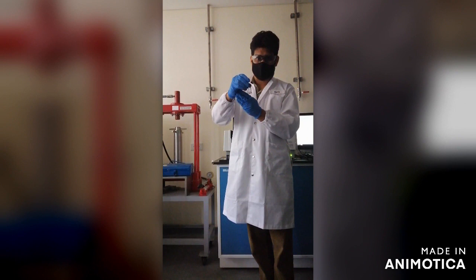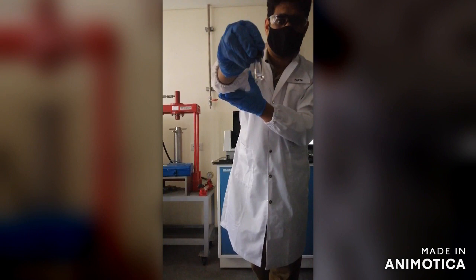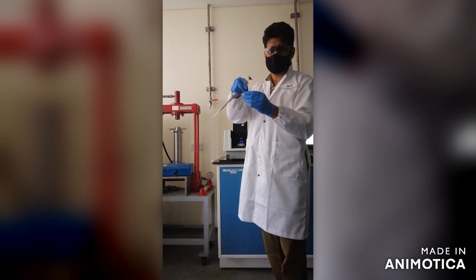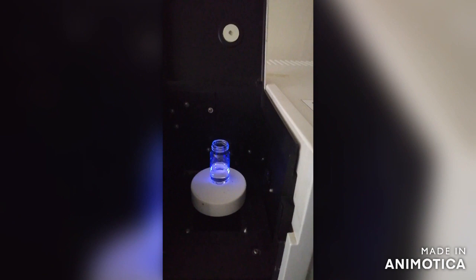Here I am holding the precursor solution, which is perovskite salts dissolved in a polar DMF solvent. I'm going to add some of the precursor solution into a non-polar solvent — toluene — in the presence of some ligands. The toluene solution is placed under UV illumination for clear visualization of the synthesis of these nanoparticles.